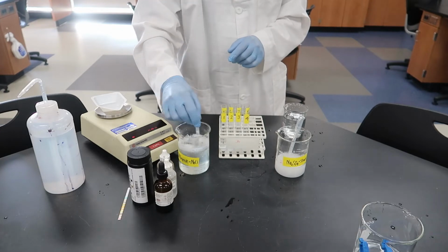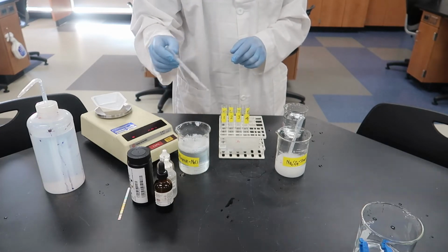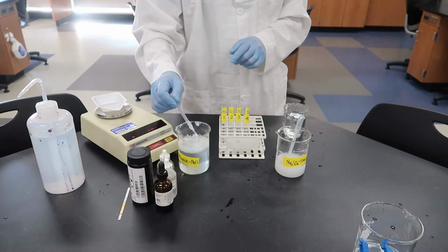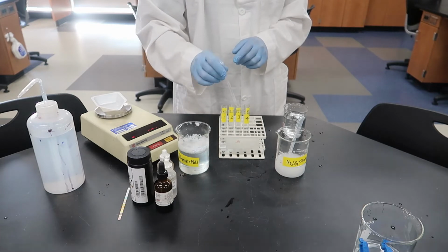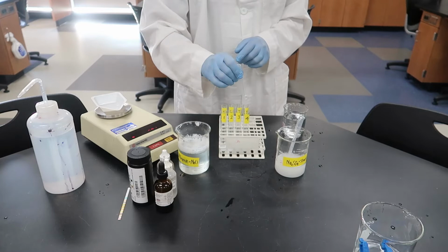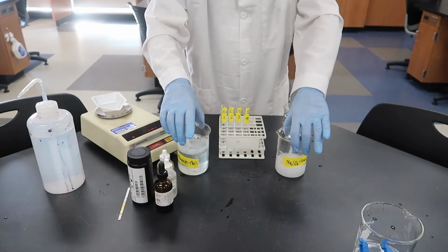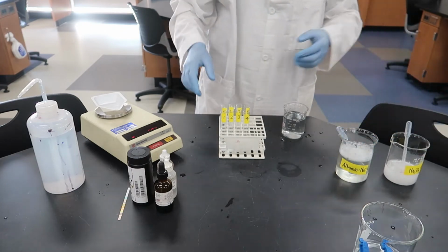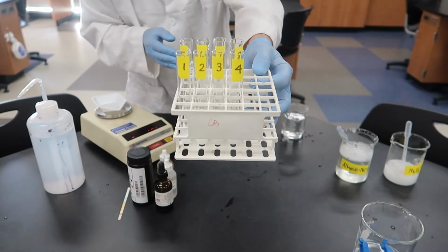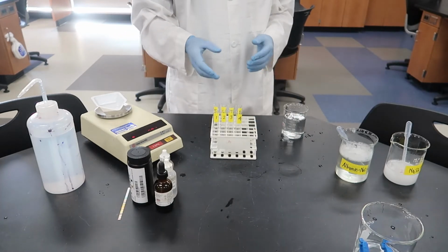Okay, and test tubes 5, 6, 7, and 8, we're going to do the same thing, but we're going to use the albumin NaCl solution. Again, putting about 3 mils in each tube. And then we'll test each of these with our indicators to see what we get. And that'll help us practice a little bit with these and verify our starting point for our experiment. Okay, there are our tubes. They've got our solutions in them, and we're ready to go.